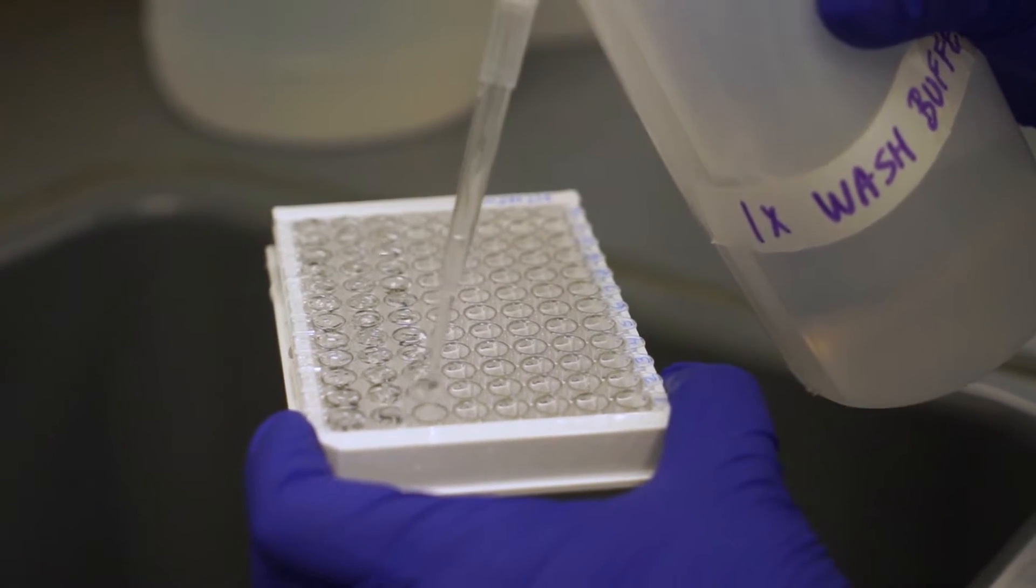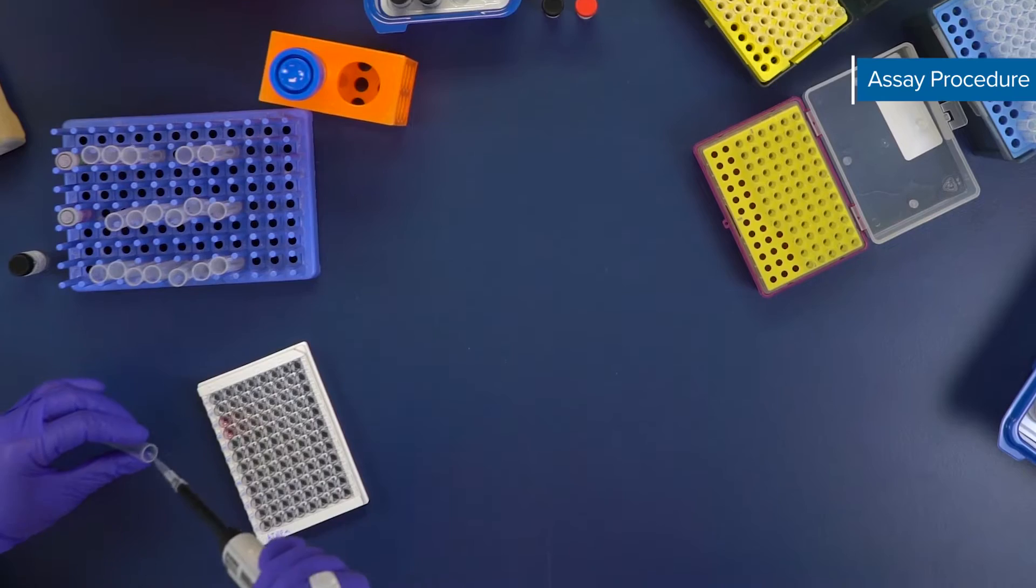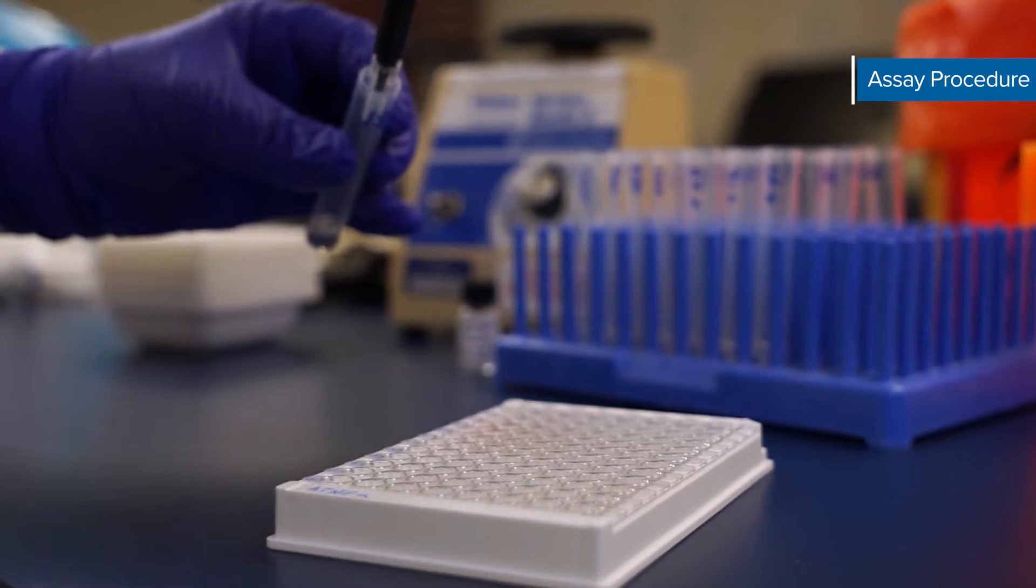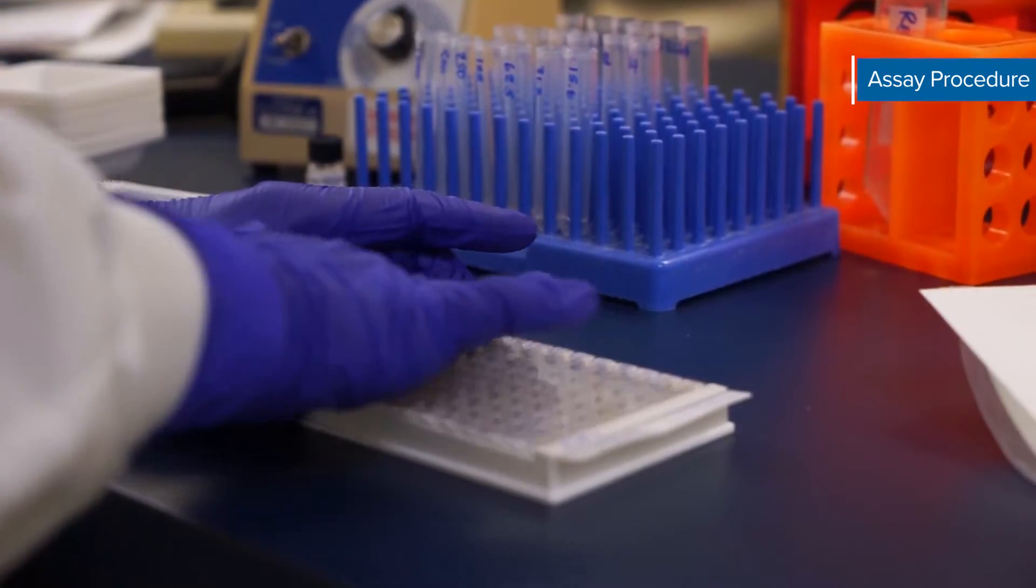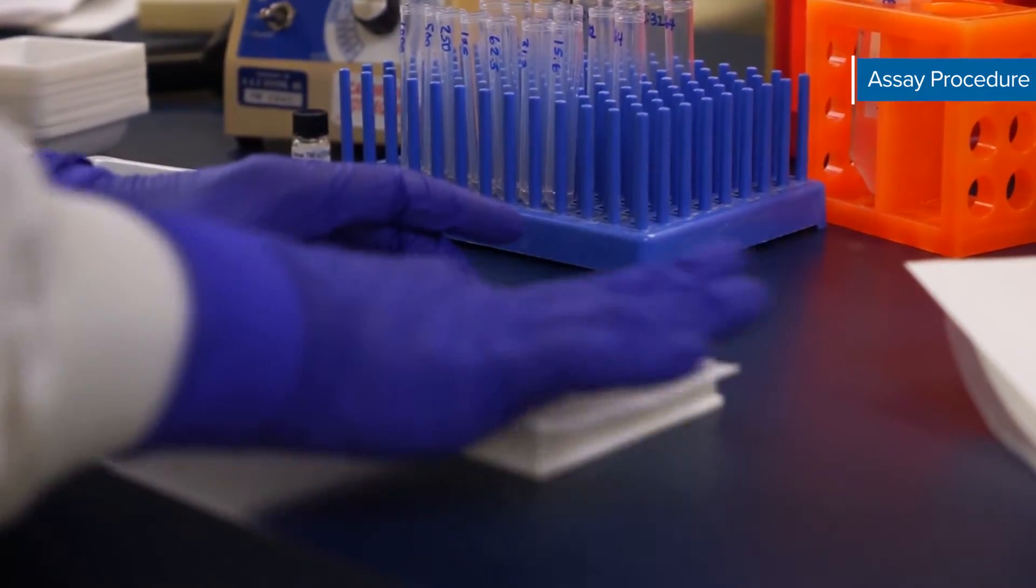Next repeat the wash step then add 100 microliters of sample or standard per well. Cover with an adhesive strip and incubate for two hours at room temperature on the benchtop.